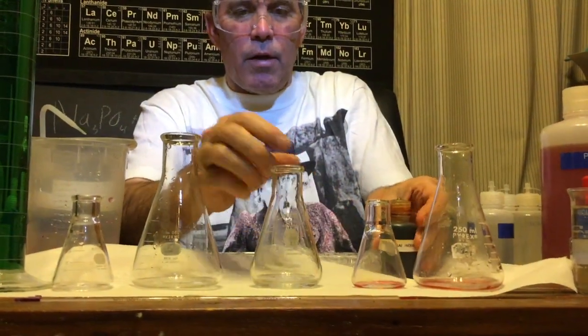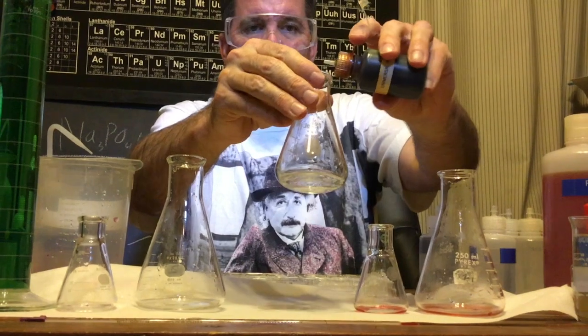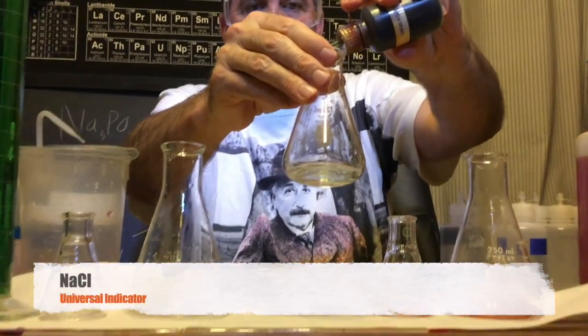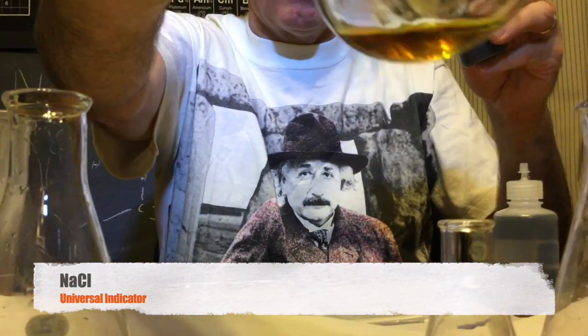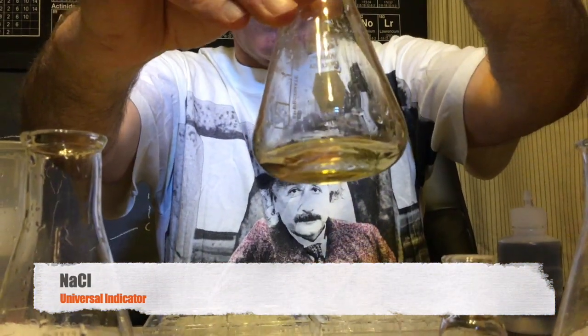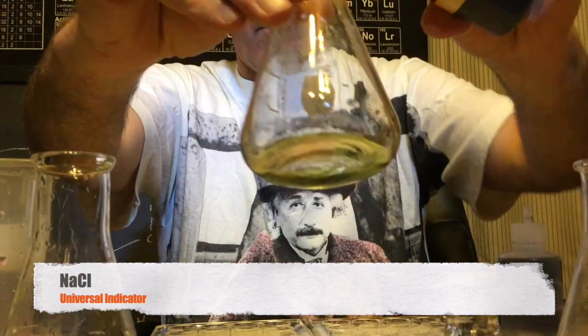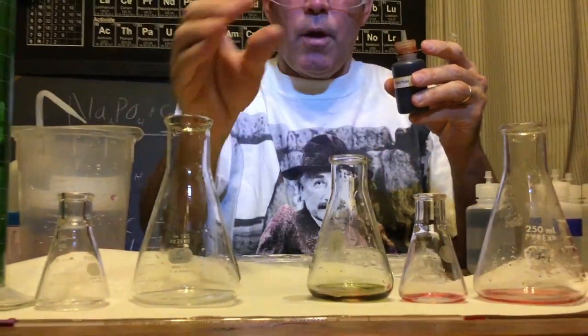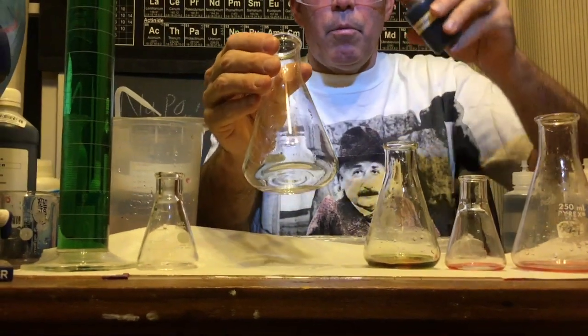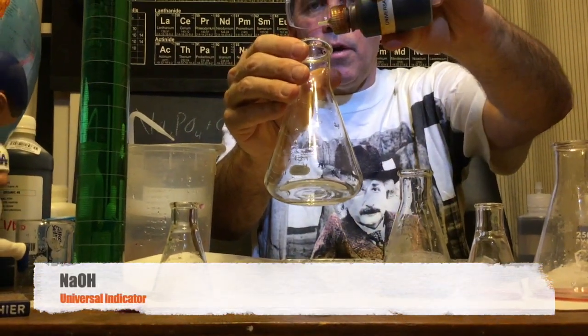Do you think it's going to be that same color? Let's see. Okay, what about in our strong base, sodium hydroxide?